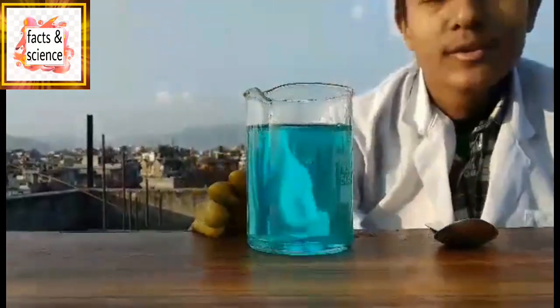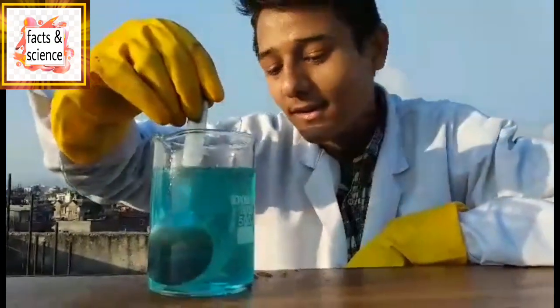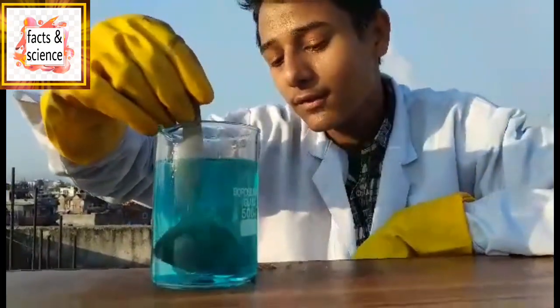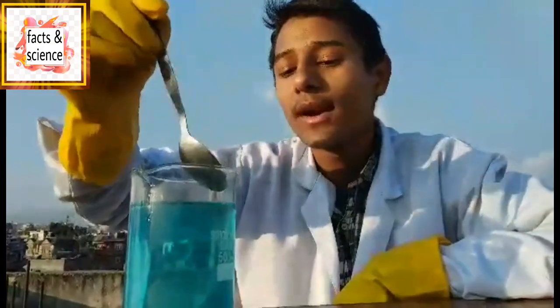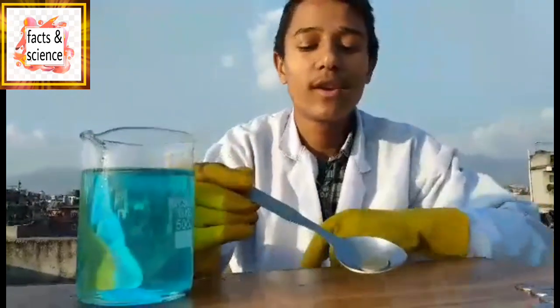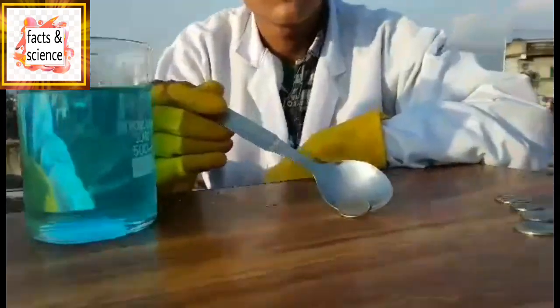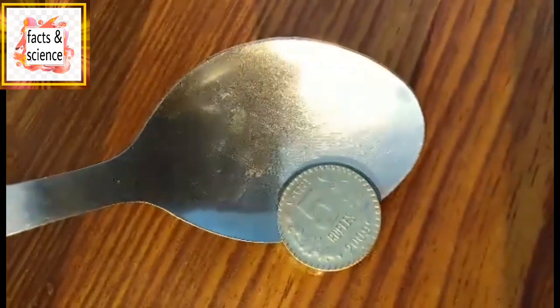I poured water because it was very reactive, and you saw that the color of the solution changed to blue. This is what the five rupees coin of India has become. But the one rupees and two rupees coins have not reacted with nitric acid.